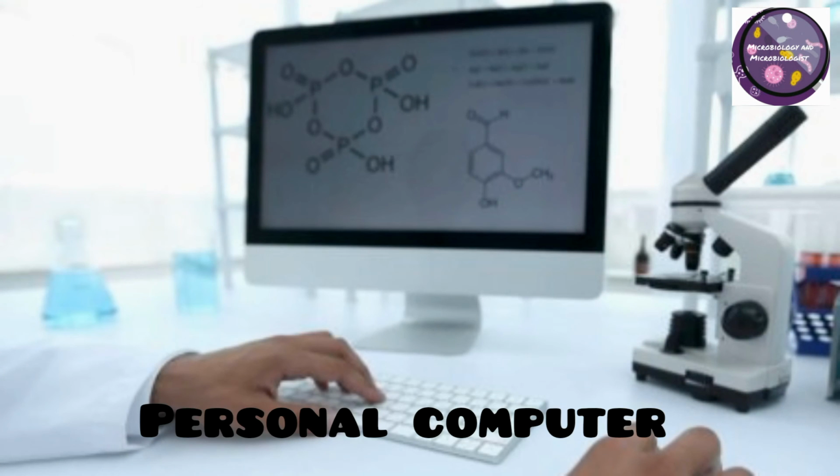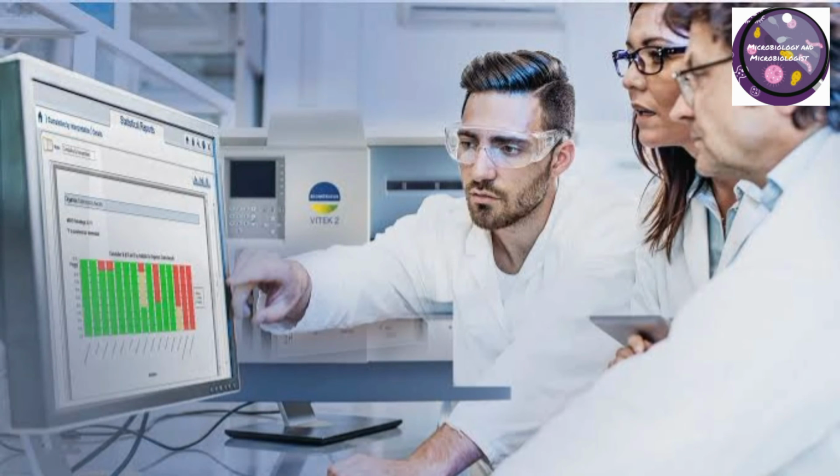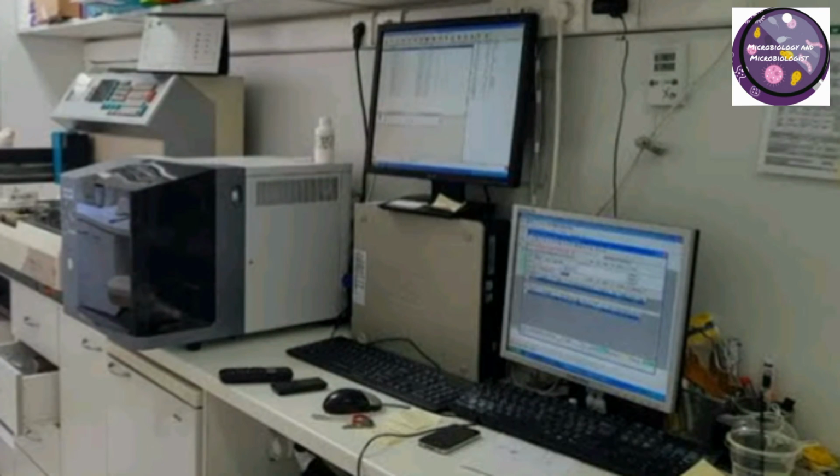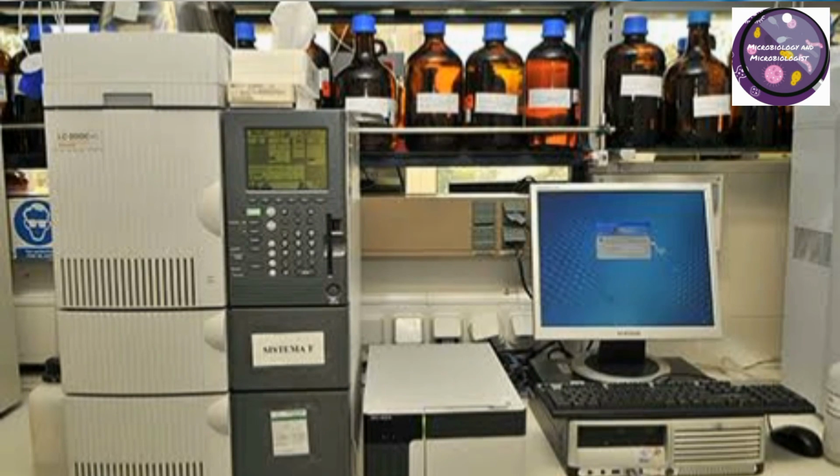Personal computer. Personal computer or PC is also important to maintaining lab work and store important databases. The reports must be generated in a proper way, so for that purpose computer is necessary for lab.